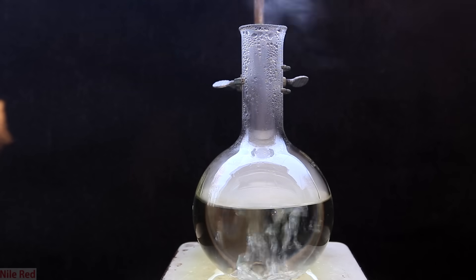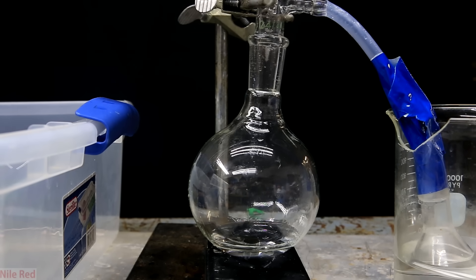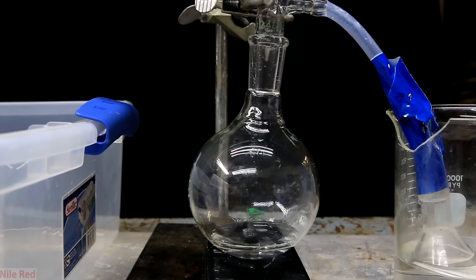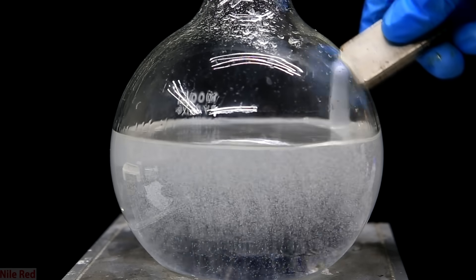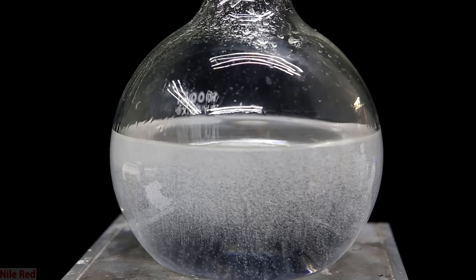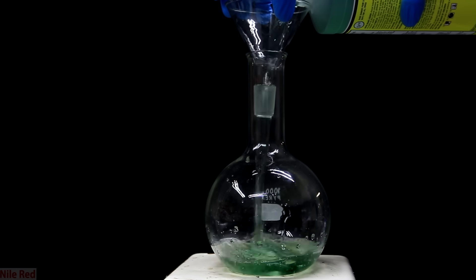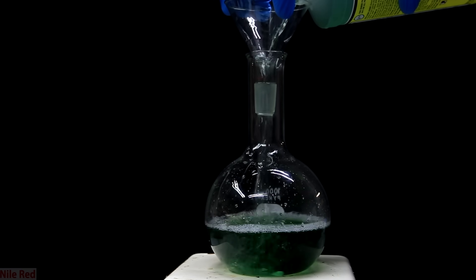So why can't we get to 100%? At 98% sulfuric acid, it forms an azeotrope with water. An azeotrope occurs when the ratio of one component to the other is the same in the liquid form as it is in the vapor form. So when we're at 93% and we boil it, it'll be mostly water coming off, but slowly as we get close to 98%, we'll get more and more sulfuric acid coming off. Eventually, once we reach 98%, the vapors that come off will also be 98% — this is called azeotropic sulfuric acid, and this is the most concentrated we'll get.